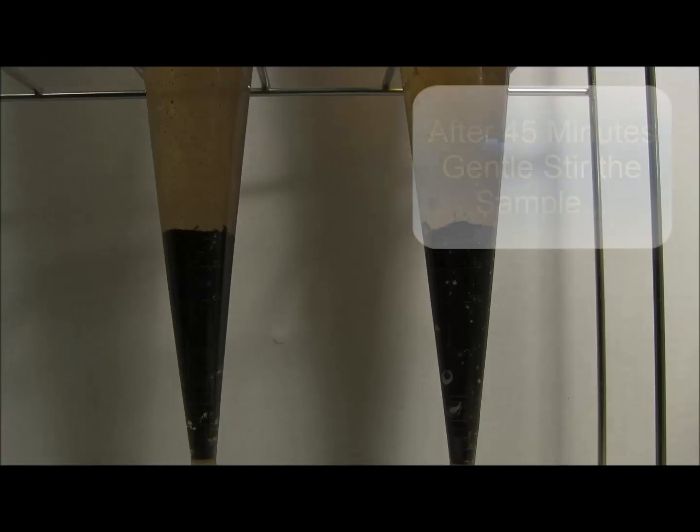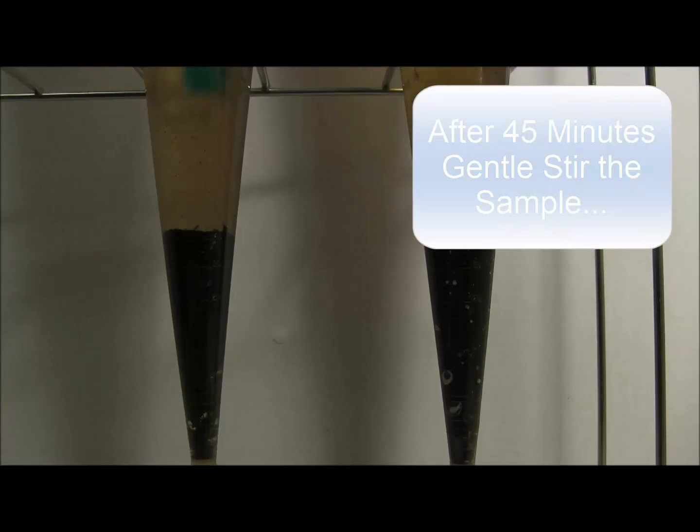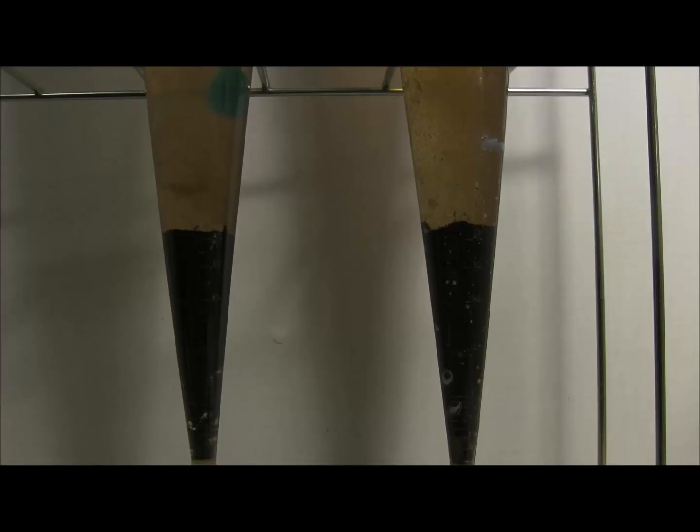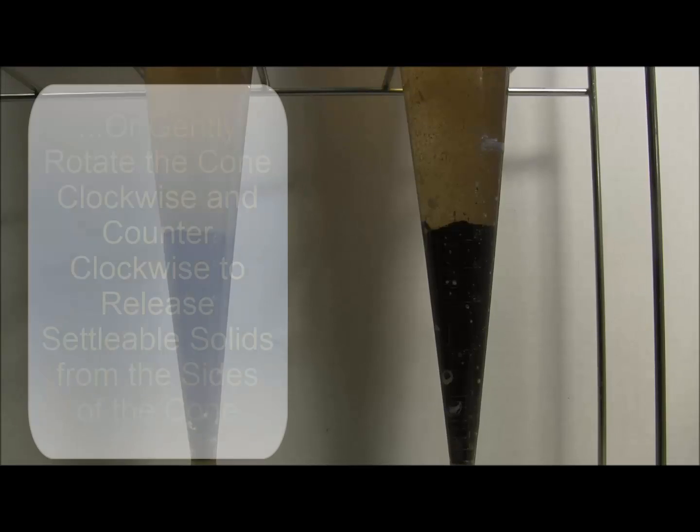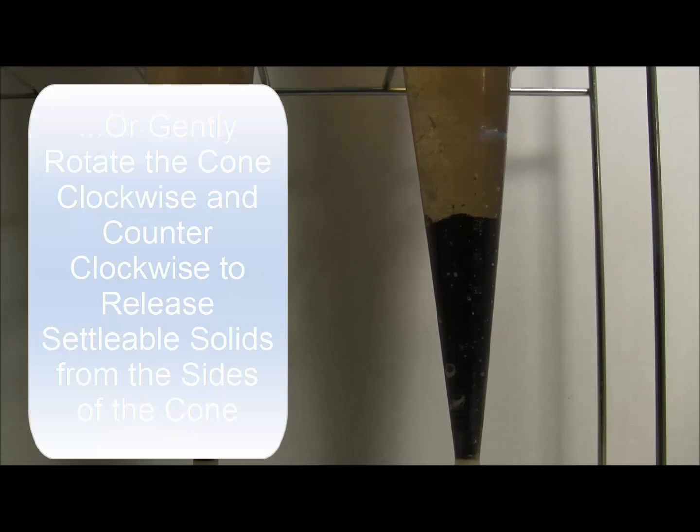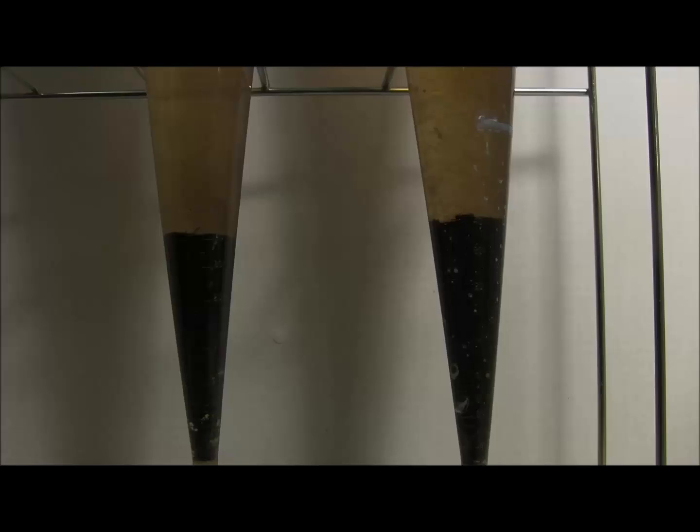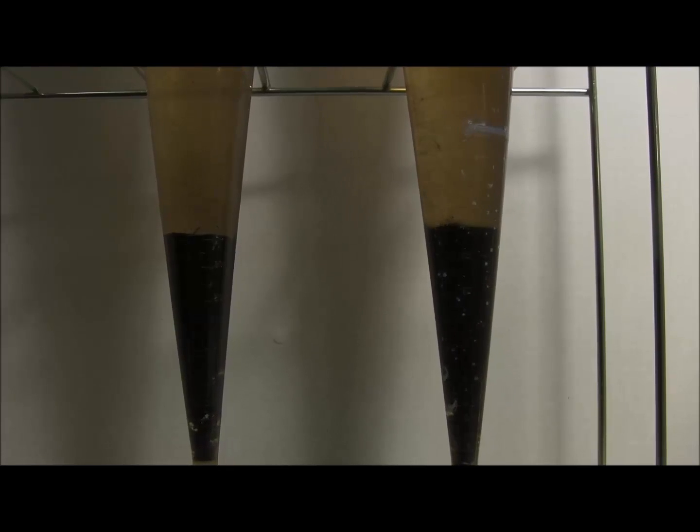When 45 minutes have passed, gently stir the contents in your Imhoff cone with a stirring rod. If you do not have a stirring rod, you can gently rotate the cone clockwise and counterclockwise to release any settlable solids that have stuck to the sides of the Imhoff cone.